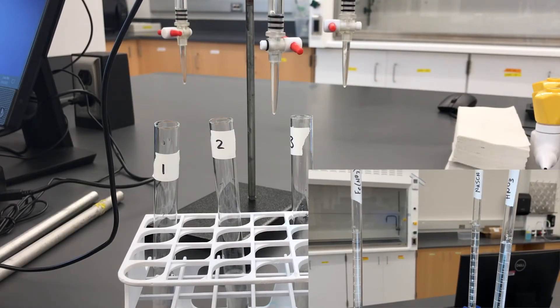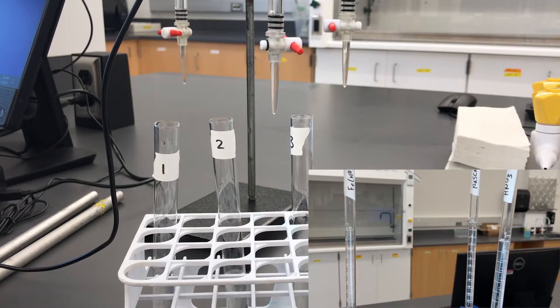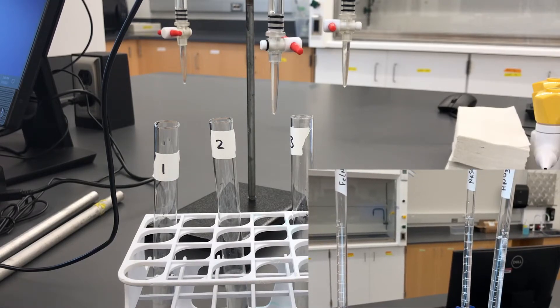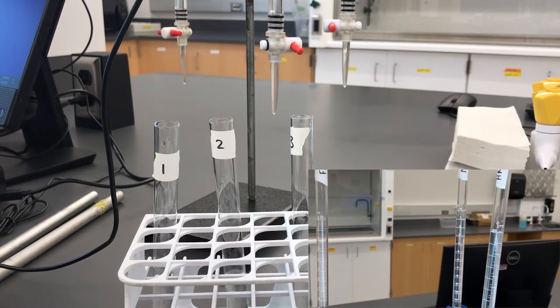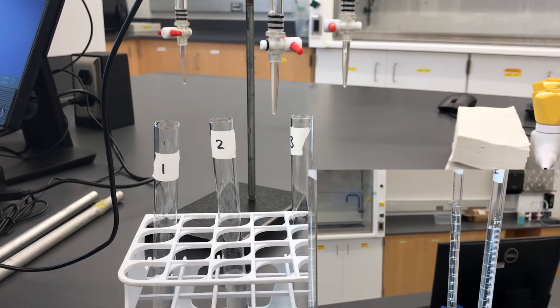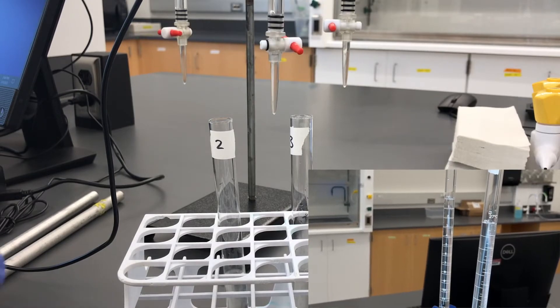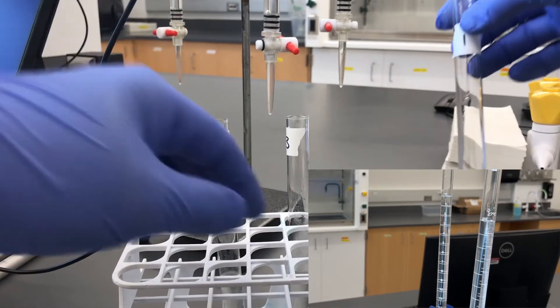Next, we'll add sodium thiocyanate in increments of two milliliters, starting with the first test tube, getting one milliliter, then to the next we'll add three, and to the last one we'll add five. So, this first one, we said, we're going to add one of the sodium thiocyanate.